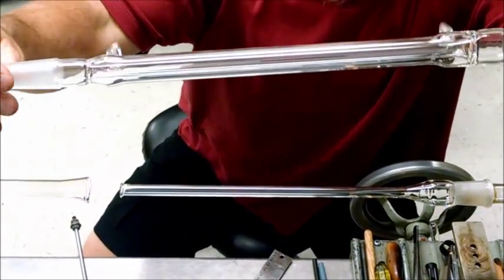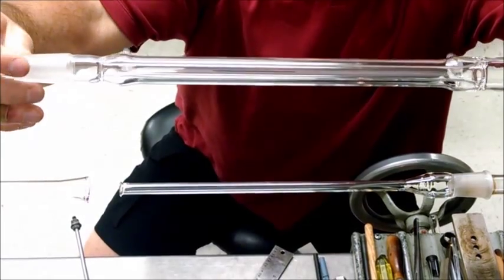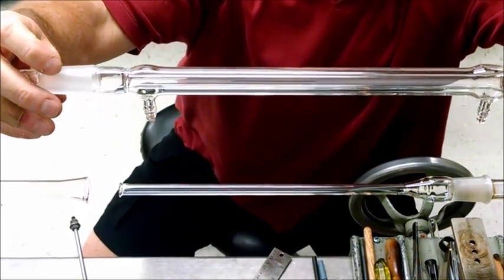Hey, how's it going? I'm building some condensers now, and I thought I'd show you this little thing I do to eliminate using cardboard.